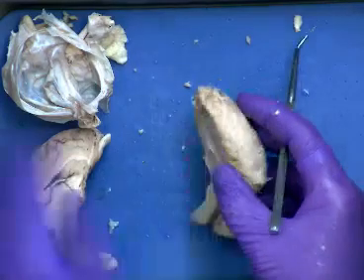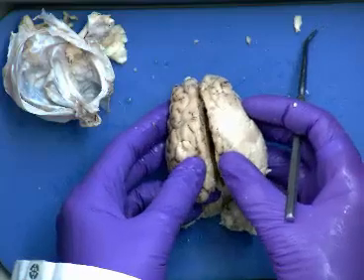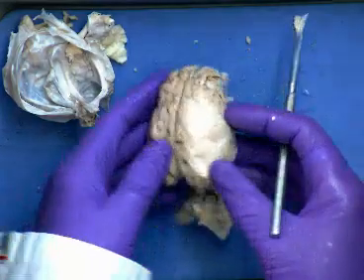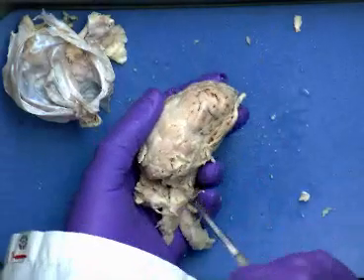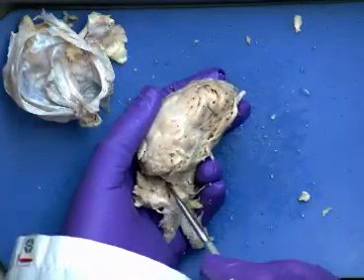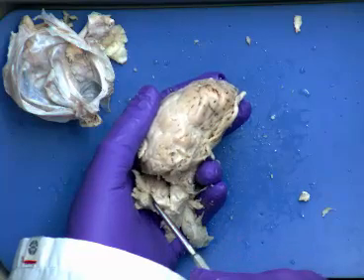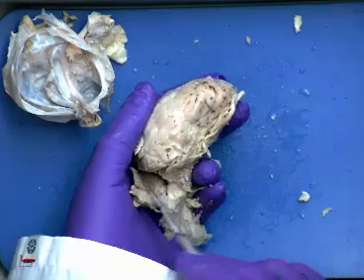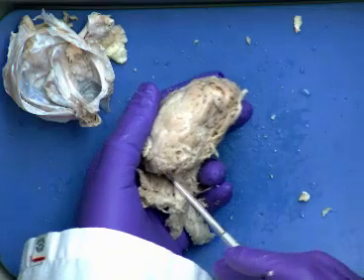Longitudinal fissure, we said, occurs between the 2 cerebral hemispheres. So again, that opening that we see there. Transverse fissure, again, a little bit messy because my cerebellum is kind of a mess. But there's a transverse fissure. There's a gap here between the cerebellum and the cerebrum. So that gap that we see here between the 2 is called the transverse fissure because it's more horizontal.